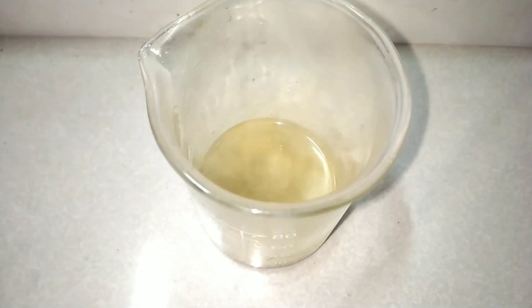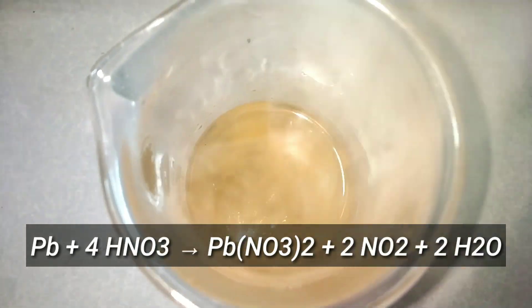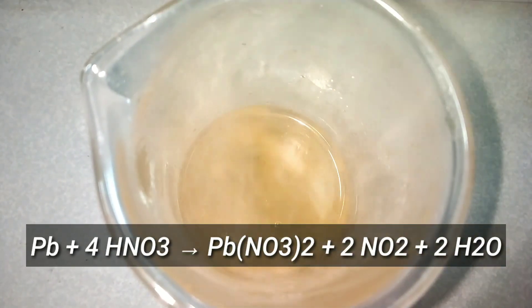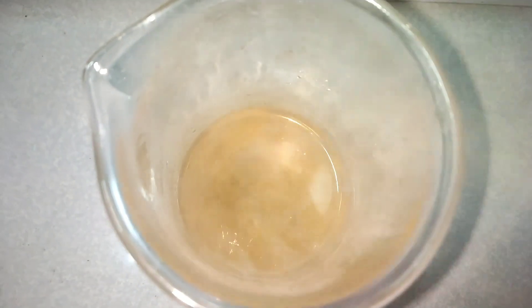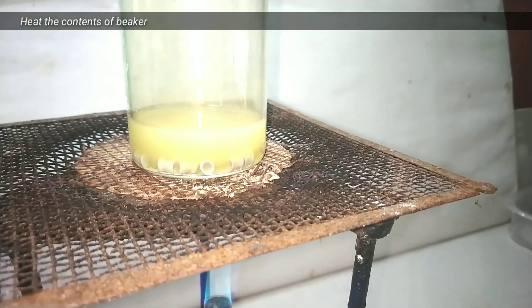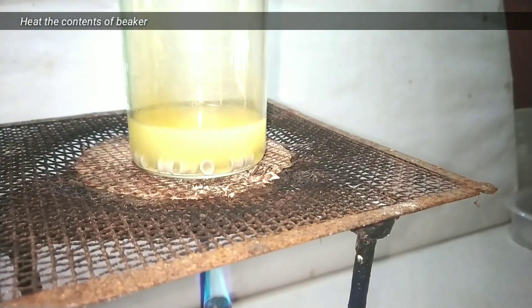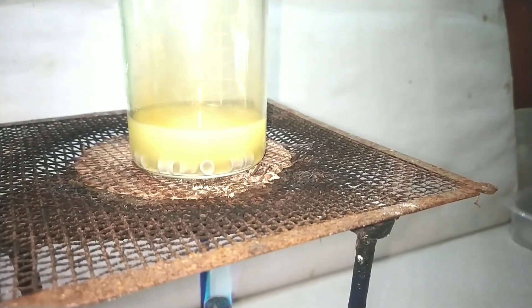What is happening here is lead metal reacts with nitric acid to form lead(II) nitrate, nitrogen dioxide, and water. To induce the reaction faster I decided to heat the beaker. On heating, the reaction is starting to get vigorous.